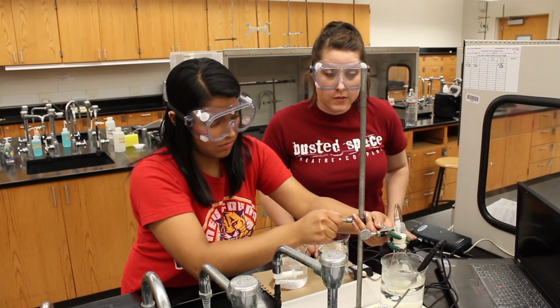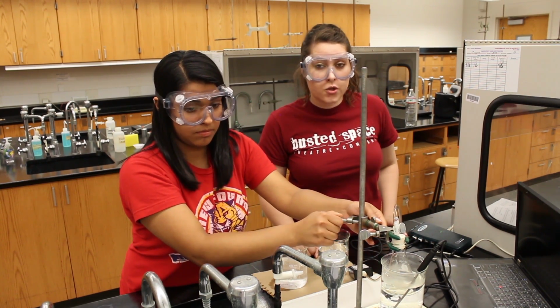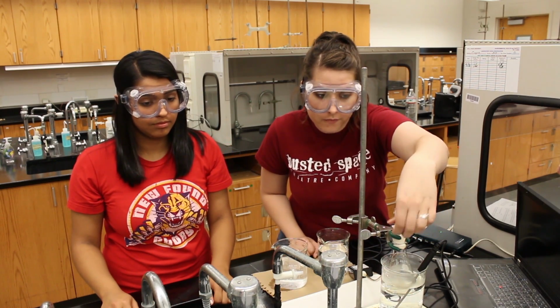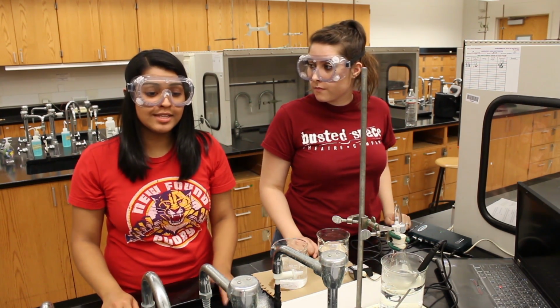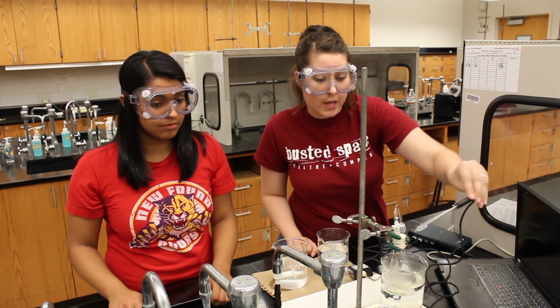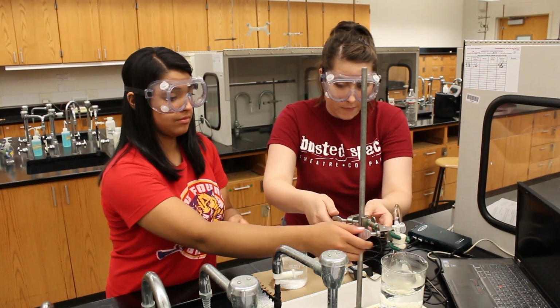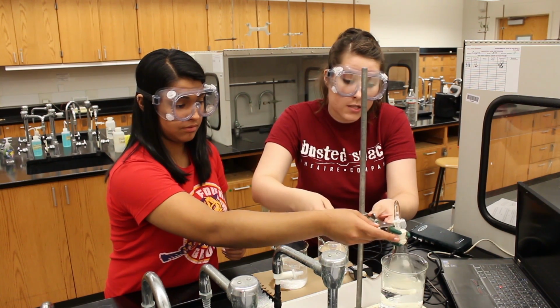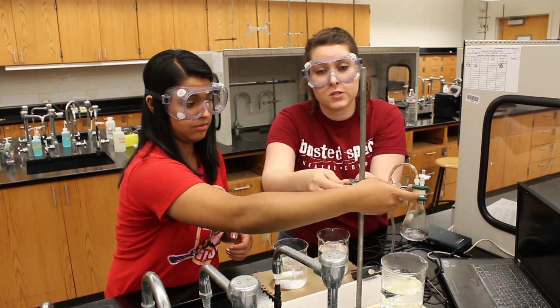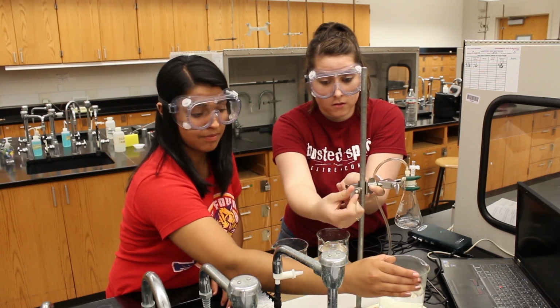Once the water boils and the temperature stabilizes, you'll want to click the Collect button and close your gas valve. Wait 5 minutes and then click Keep. Carefully then remove the probe and the flask from the hot water bath. Be sure to keep your valve closed. If the gas valve opens, you'll ruin your data.